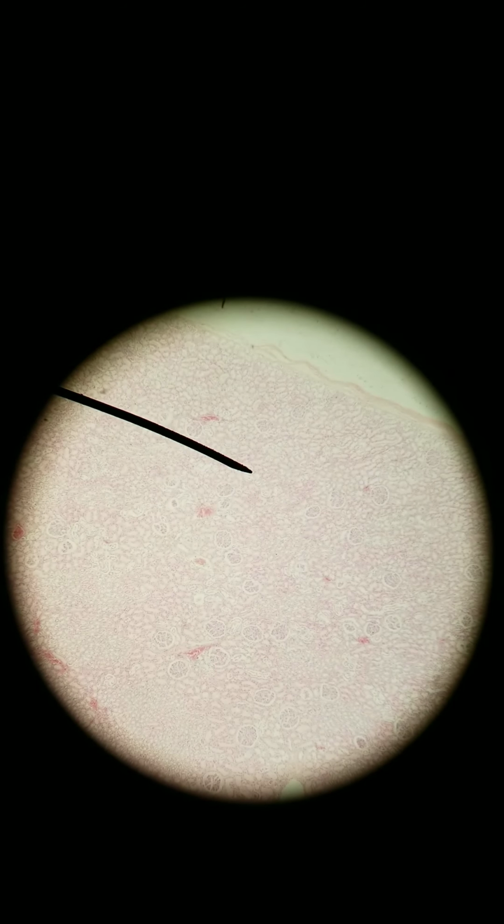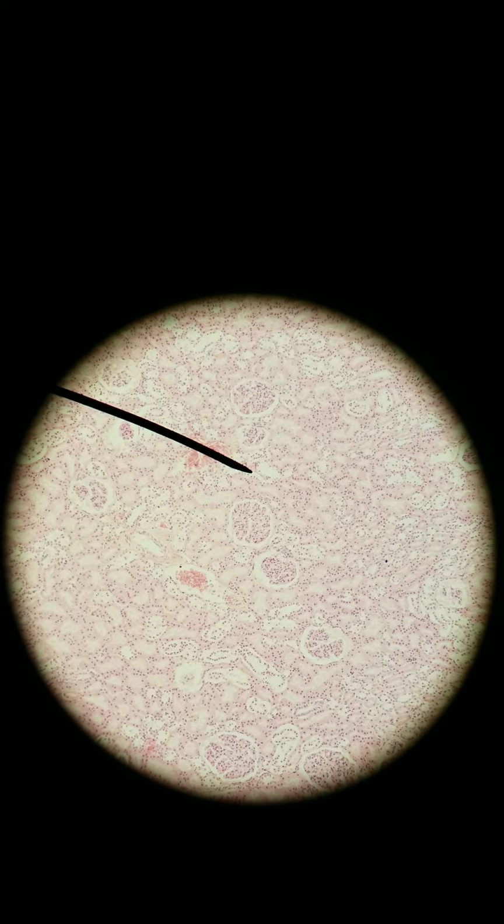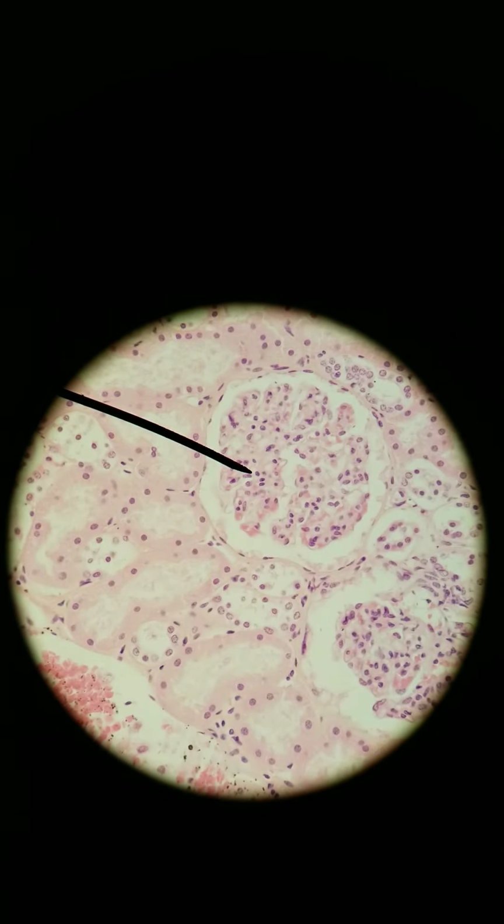I just showed you squamous cells in cross section. We're going to switch now to longitudinal section. This is cells from a kidney. So here we are in the kidney. You see a bunch of things going on here, lots of tubes, and we'll talk about what the kidney's made of later, but we're going to zoom in on those weird circle-looking things with the white space in the outline. So here we are at 100x total. Still need to get closer. Here we are at 400x total.